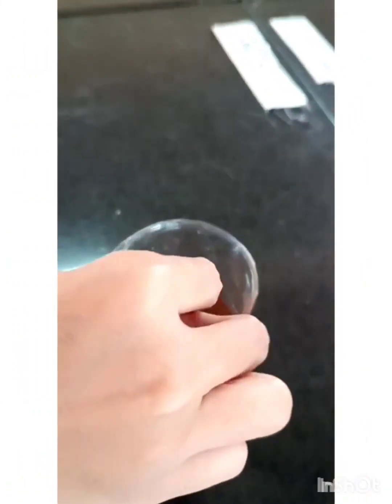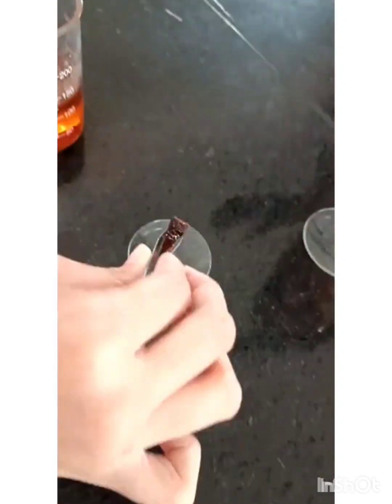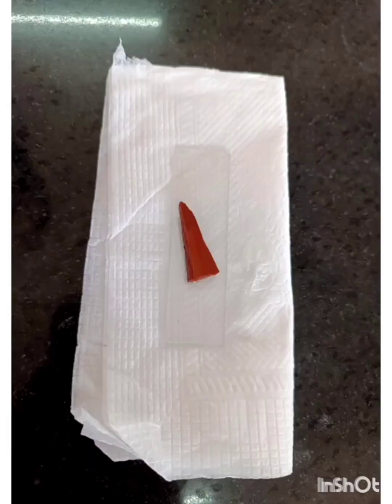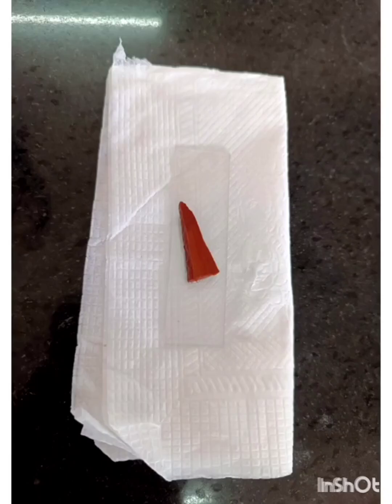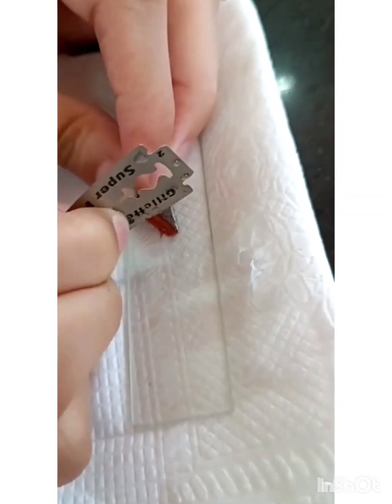Take the crude drug of cinnamon bark from the beaker which is already boiled. Take that crude drug in the watch glass, and in another watch glass take some water. Then place the crude drug on the slide and take the transverse section of it.